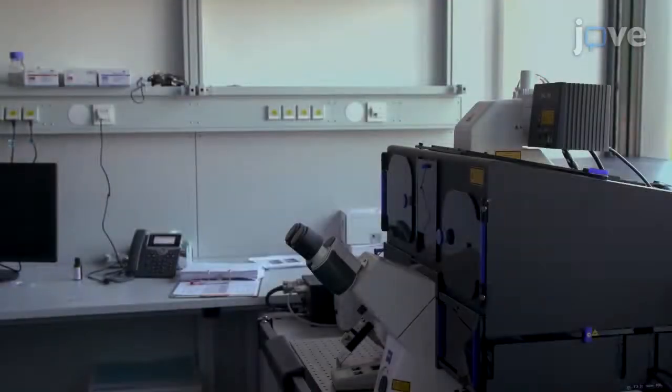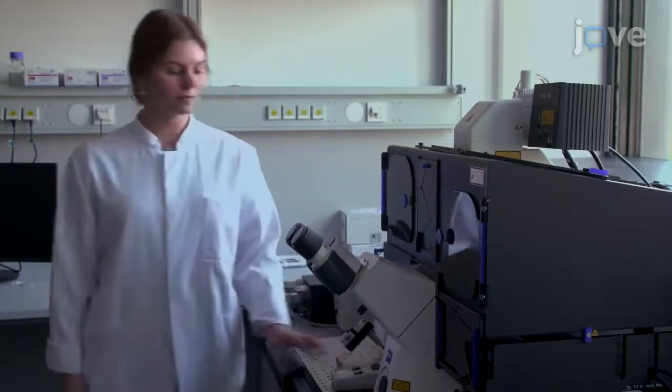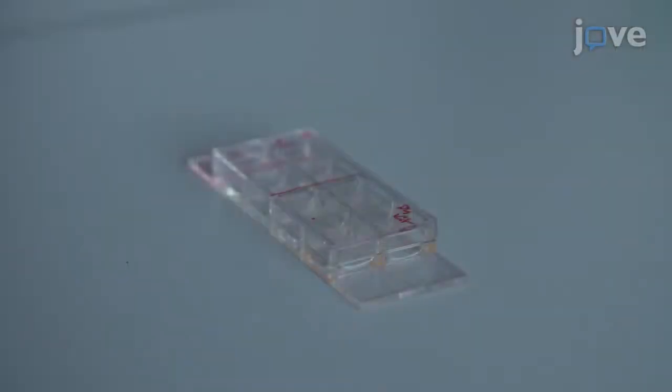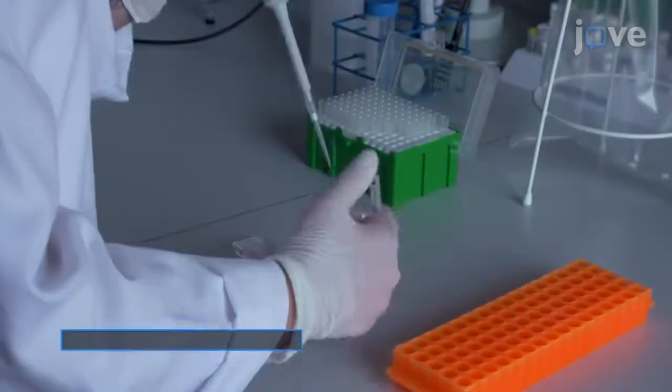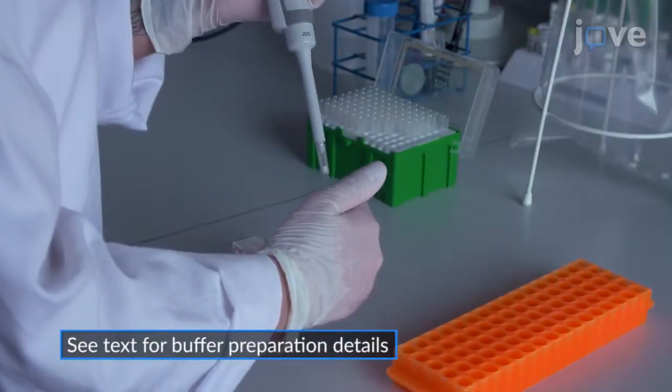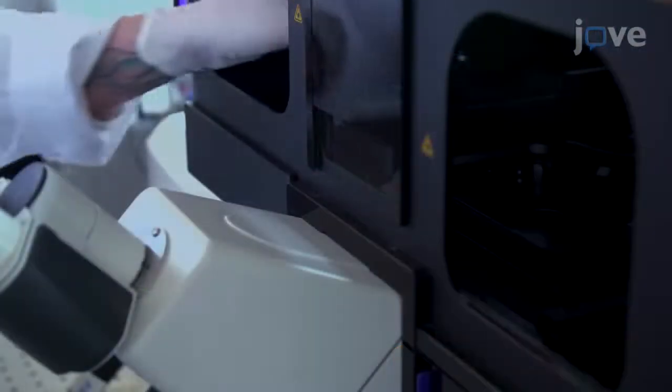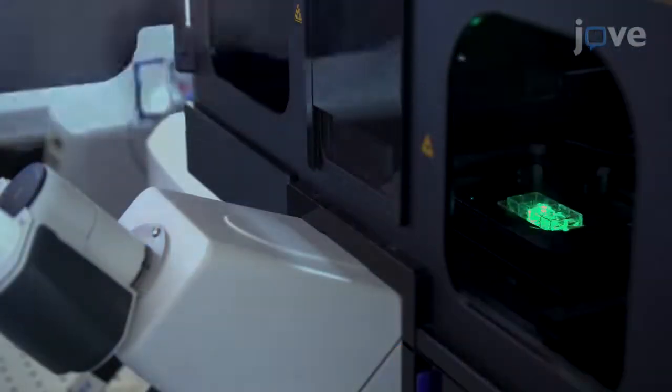At least 3 hours before use, switch on the microscope and bring the sample to room temperature. When the microscope is ready, add 300 microliters of PALM imaging buffer to a well of labeled cells and insert the chamber slide into the stage holder of the microscope.